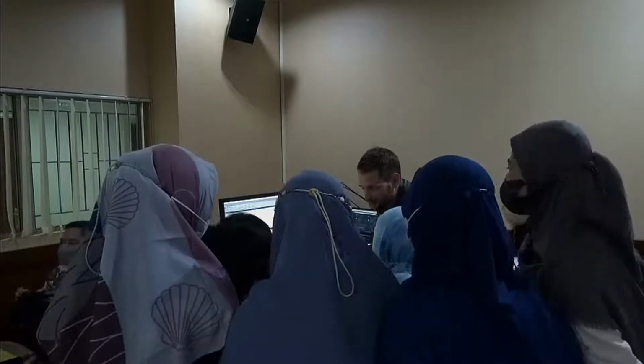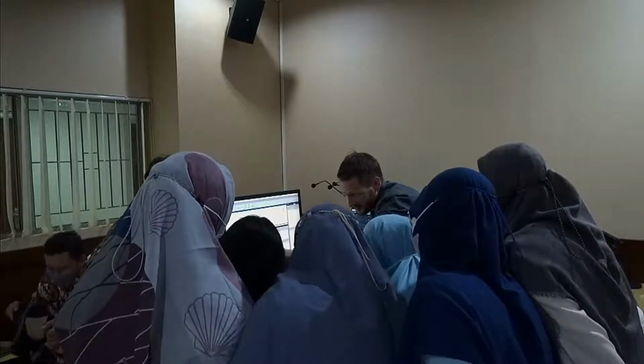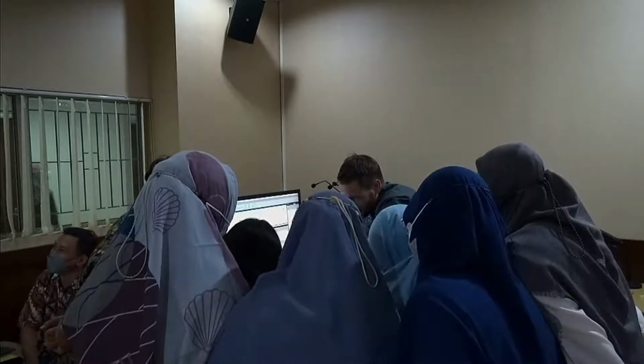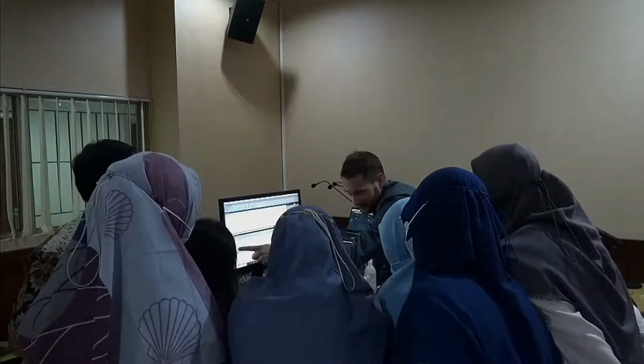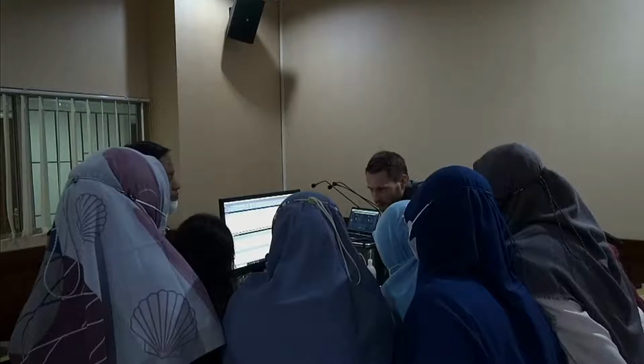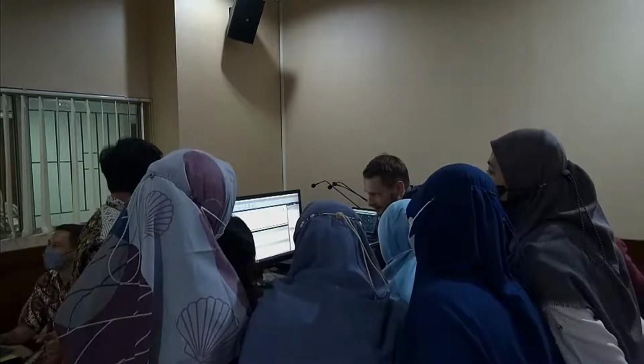So to give you an idea, you see here the variation coefficient between our 3 measurements. The ISO 13320, which is regulating laser particle sizing, gives you maximum limits for NIST traceable standards, so they should actually come in better. This is not NIST traceable still. The limits are 2%, 1.5, and 2.5, so you can see we are more than 10 times below the official limits, which is pretty good, in my opinion. As I said, in the previous one, we were even better with the ultrasonic, but that's really crying on a very, very high level.